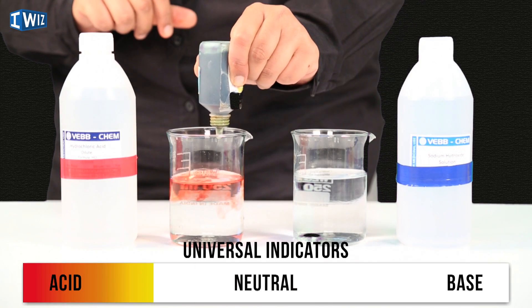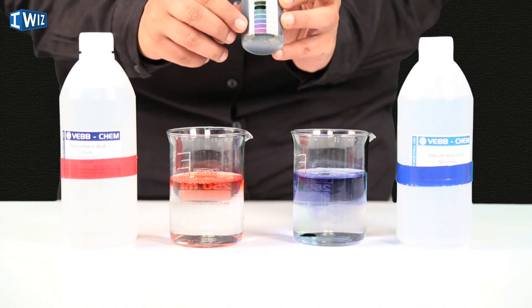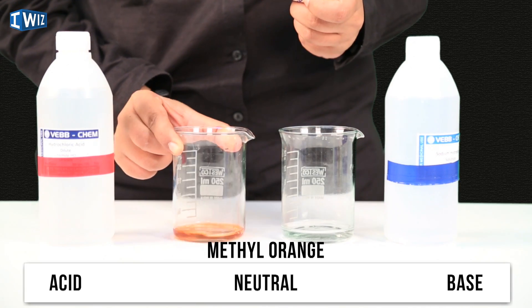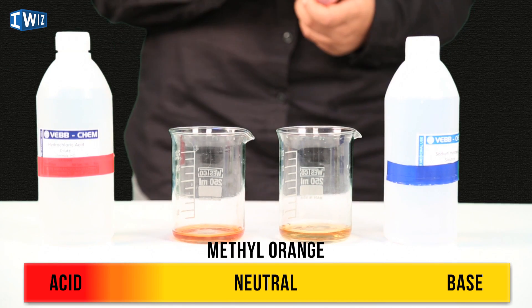The next indicator is the universal indicator. In the acidic solution you can see it turns red, and in the basic solution it turns a deep blue to violet. In fact, the magic trick we did at the start used different pH levels of acids and bases to produce the whole spectrum of colors the universal indicator gives us. The final indicator is methyl orange — in an acidic solution it turns reddish, and in a basic solution it turns yellowish.